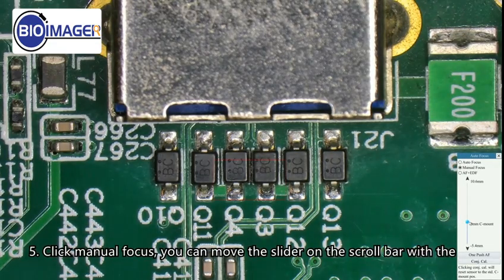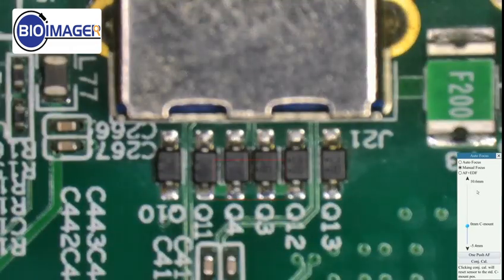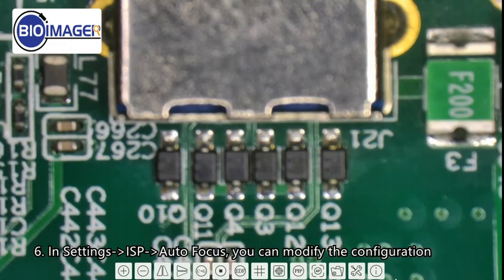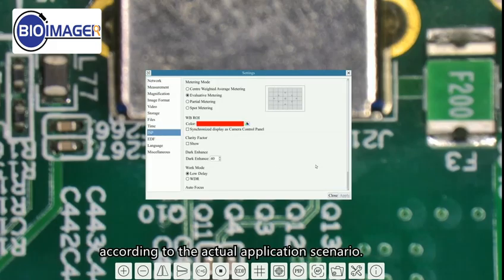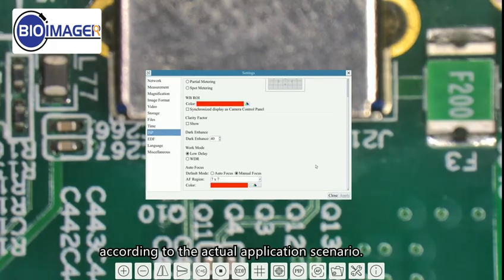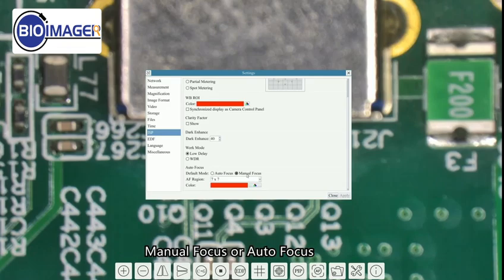Click Manual Focus. You can move the slider on the scroll bar with the mouse to focus. In Settings > ISP > Autofocus, you can modify the configuration according to the actual application scenario. Default mode, you can choose the default focus mode after power on, manual focus or autofocus.